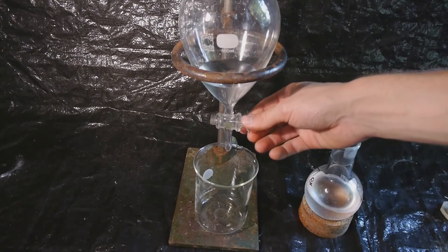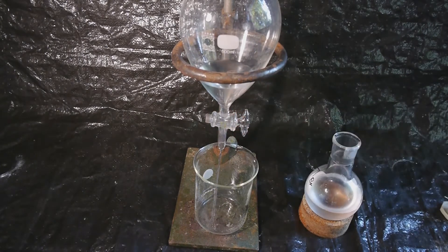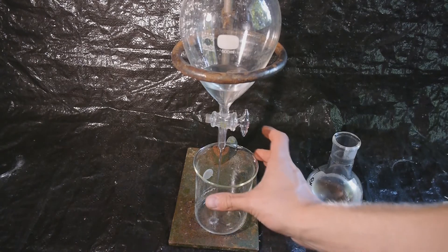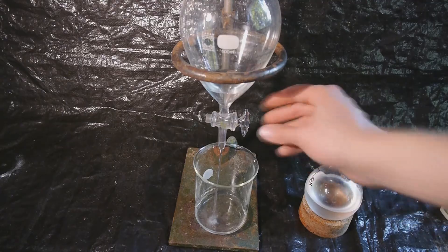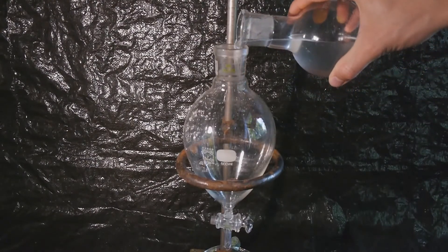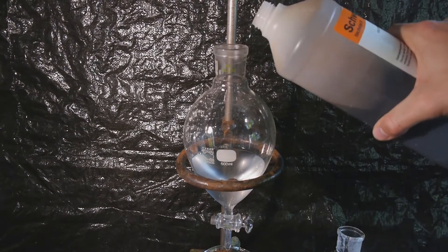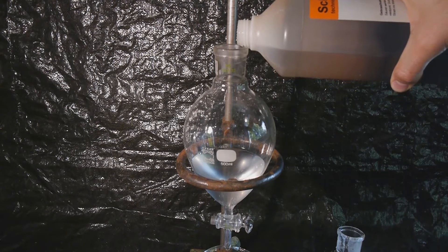The water layer can safely be discarded after having treated it with concentrated sodium hydroxide to remove any remaining ethyl bromide. I will then pour the solution back into the separatory funnel and then carefully add some concentrated sulfuric acid to wash out any remaining trace of ether.